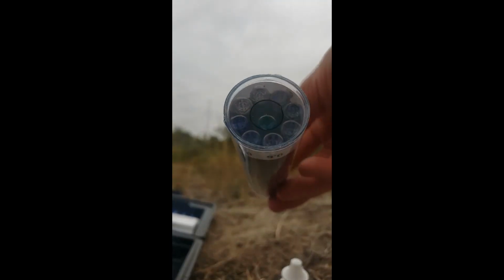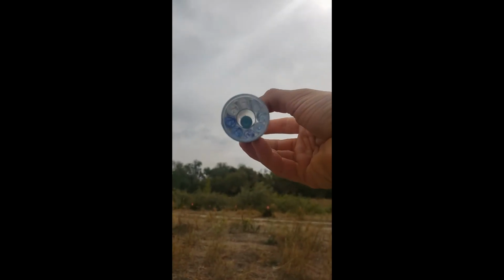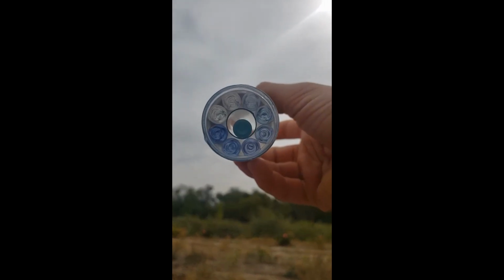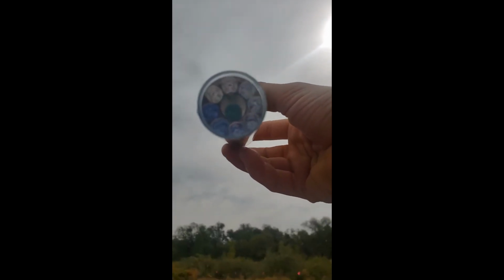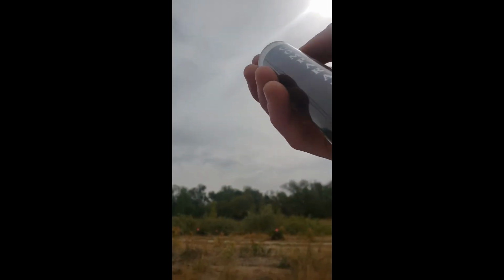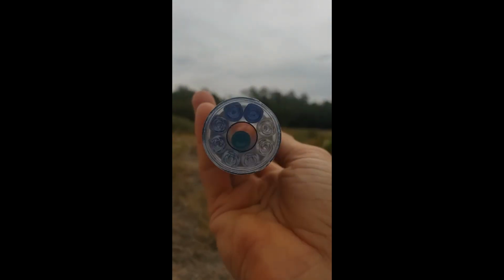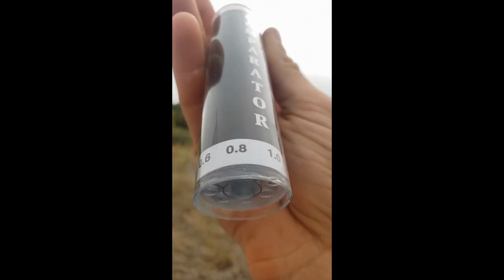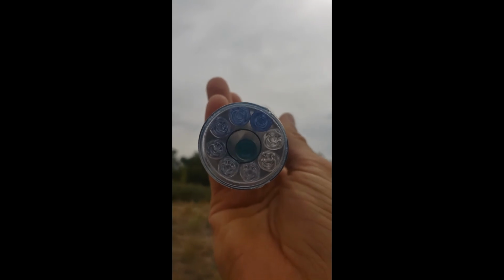Okay, so I put it in and now I look to see and sort of see there. It's hard to tell, but you compare then this to the colors around it. Oh yeah, you can actually definitely see a color change. It's like a different color blue, but it's a little bit darker. So I'm gonna go around and see that darker blue is at 0.8. See if you can see that. This goes to that. Alright, and if this is getting frustrating that you can't see it in person, come out tomorrow if you're in the Salt Lake area, and we'll do this water monitoring together.